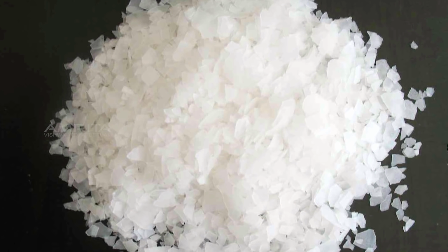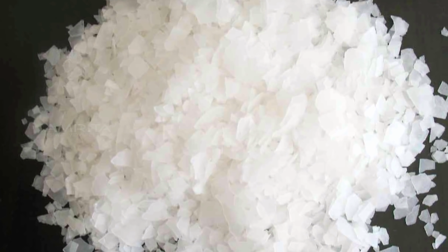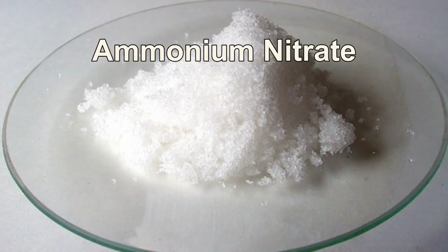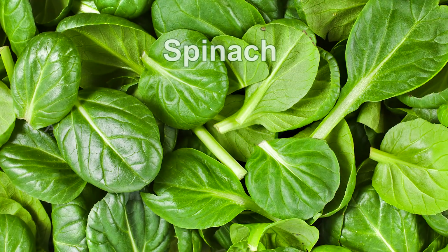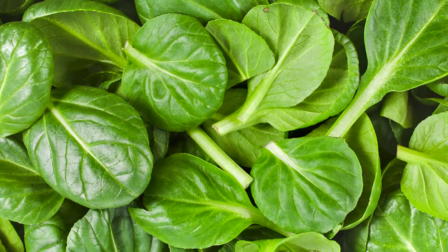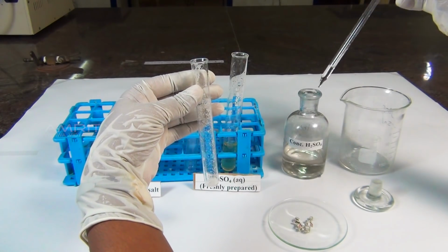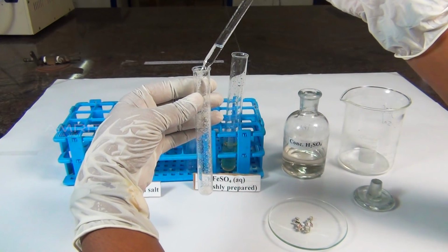Common examples of inorganic nitrate salts are sodium nitrate, potassium nitrate and ammonium nitrate. Leafy green foods such as spinach and arugula are a rich source of inorganic nitrate. Our aim here is to test for the presence of nitrate ions in a given salt.